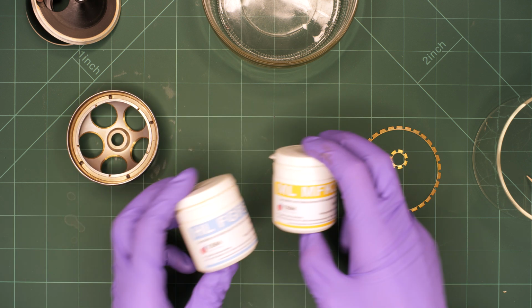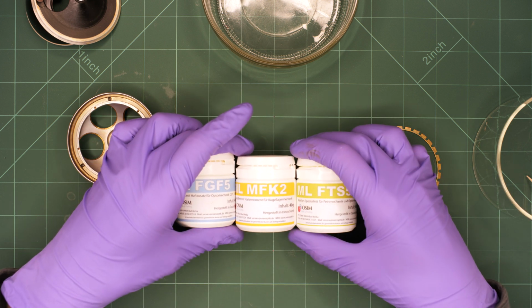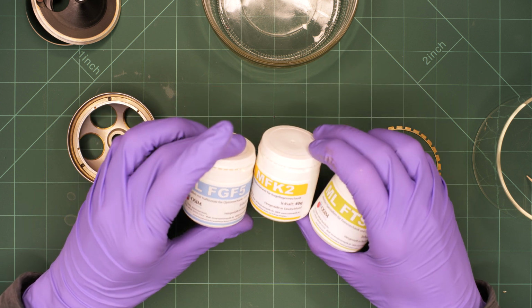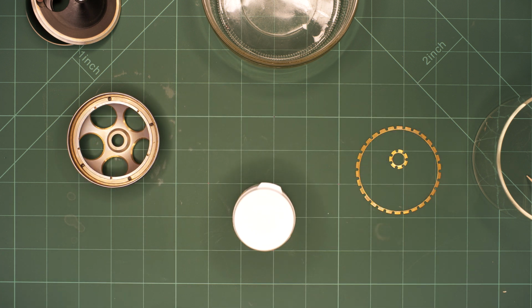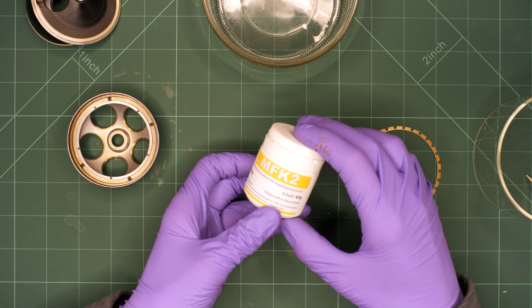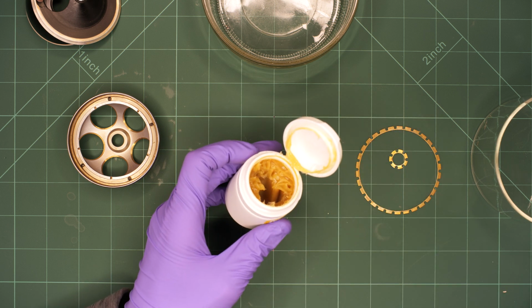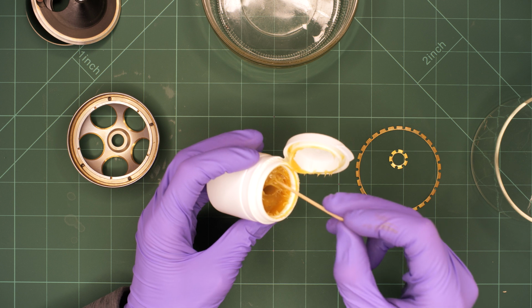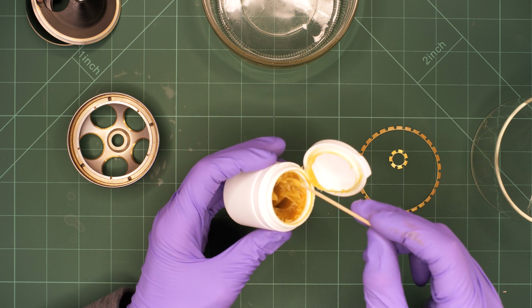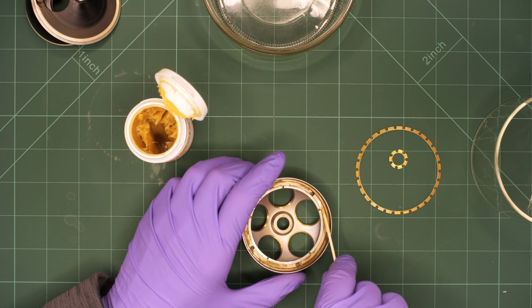It's best to have a set of different types of greases to find the one that is most suitable for the job. I tend to use a thicker, rather stiff grease for nosepieces, as soft greases often turn a nosepiece into a self-rotating carousel. In this case, I use the ML MFK2 from OsimOptik, which is a special grease for ball bearings. I'm just playing around with the grease here a bit so you can imagine the consistency. Now we simply lubricate everything generously.